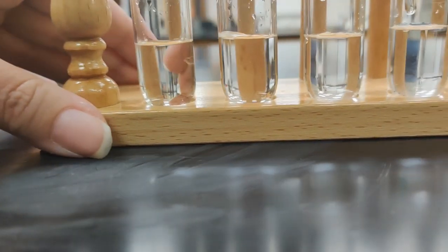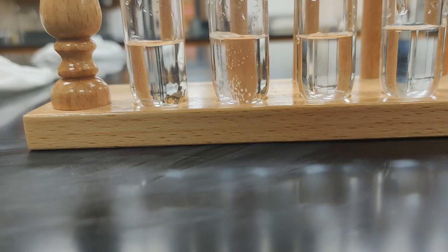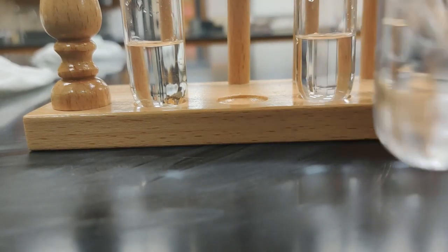So our next substance we're going to test is ammonium chloride. And that is, of course, an ionic compound, being as how it has ammonium, a polyatomic ion, right in it. So we're going to get just a tiny amount of ammonium chloride on the tip of our scoop. It's a white solid, so we're going to drop it in there. And then we'll do the same thing we did before. We'll agitate, stir it back and forth a little bit.